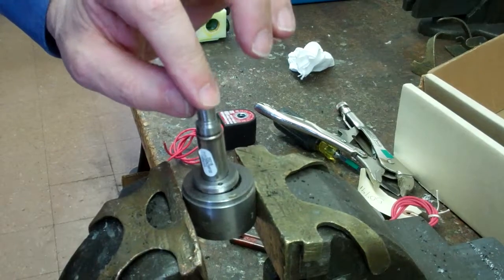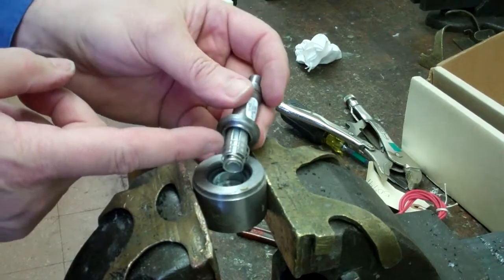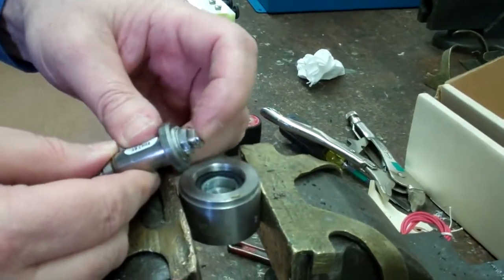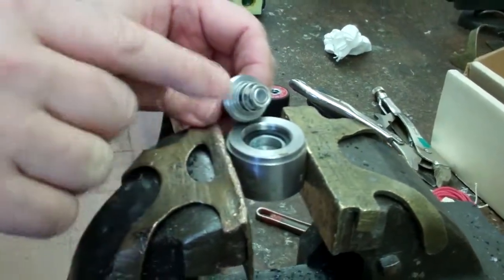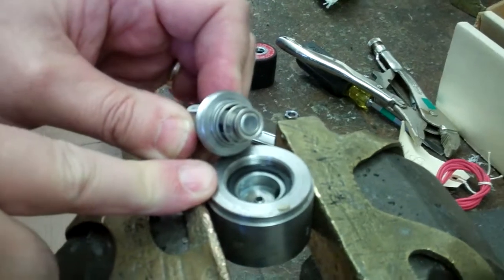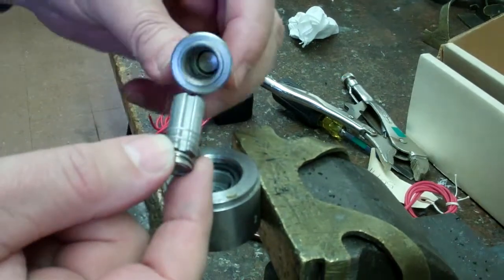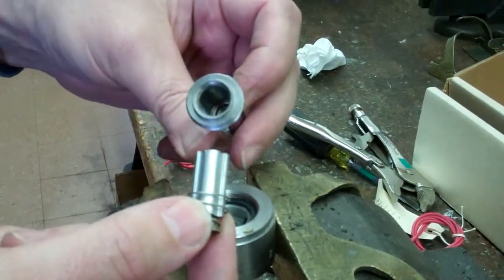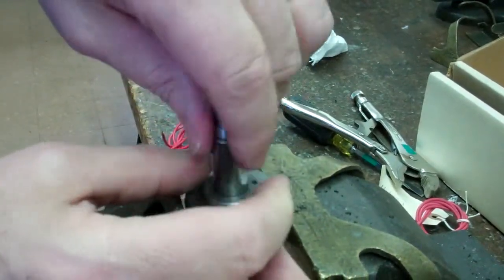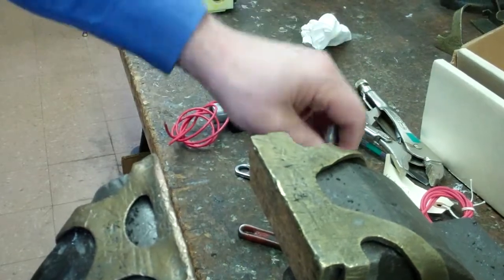Notice, see it popping up and down? I open this, see it's all loose and clean. So that's how a solvent valve is supposed to look. It pops in and out. Now this valve actually came back from a customer who was using a trial and was putting solvent through here. So there's no residue here. So I'm going to screw this back in. I'm going to pick up the other valve body.